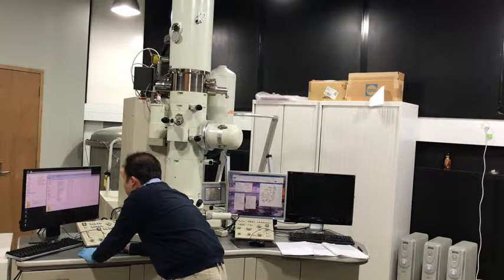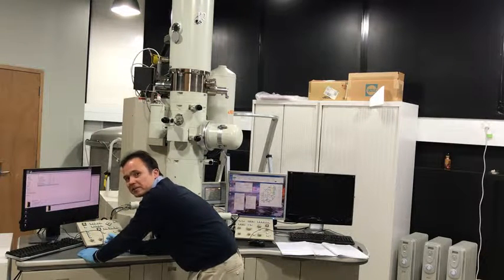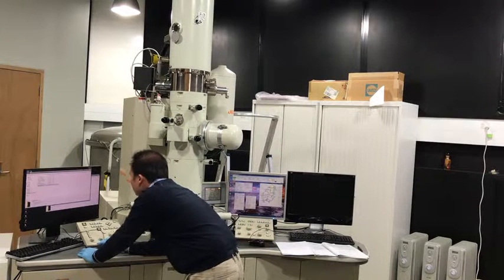MTE 4598, mystery alloy. All of that's going into the online repository. It's 443 megabytes. I'm going to take the most important images, convert them into TIFFs for you, and condense everything you need into one folder to be put on Moodle. Okay, so that's that done.